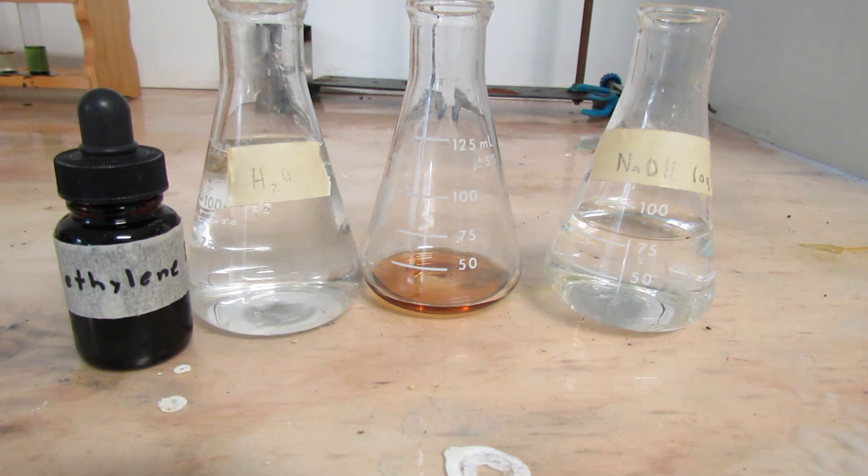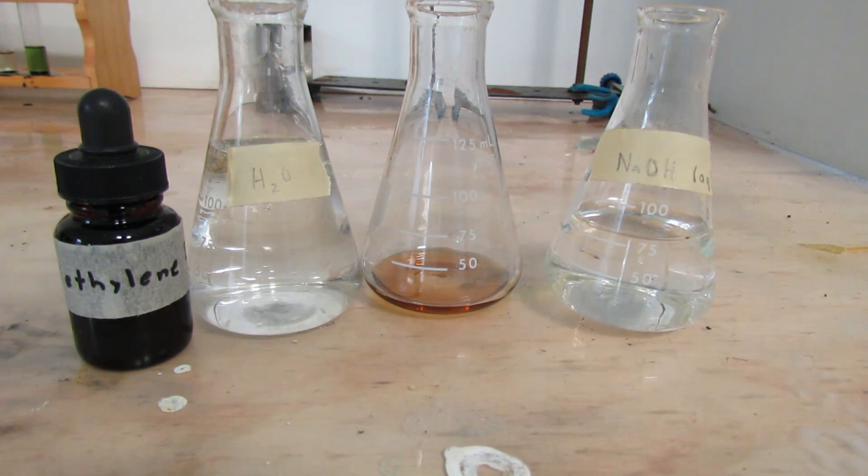Hey guys, this is GooverKingScience and today we are going to be performing the blue bottle experiment.